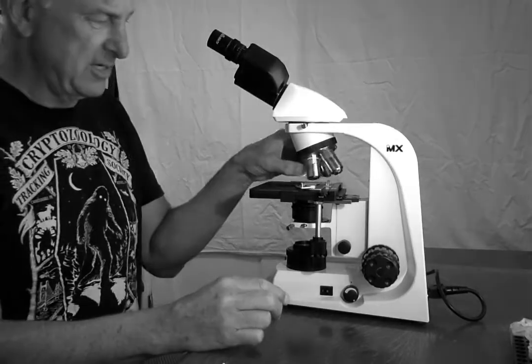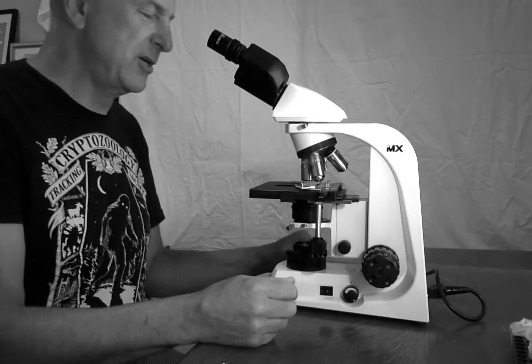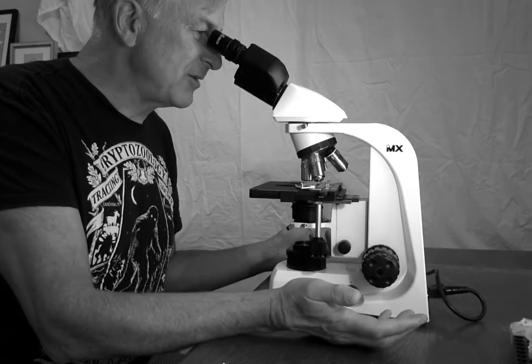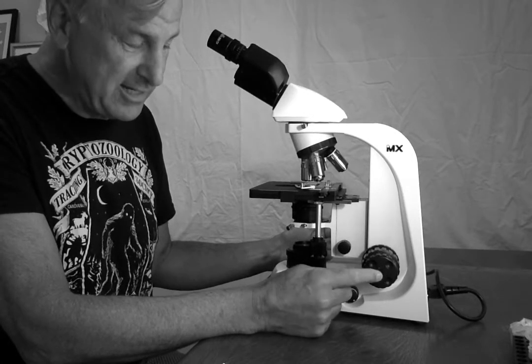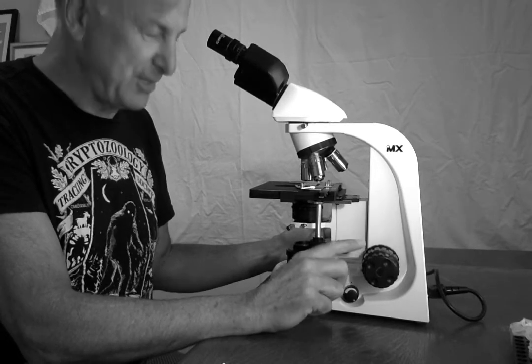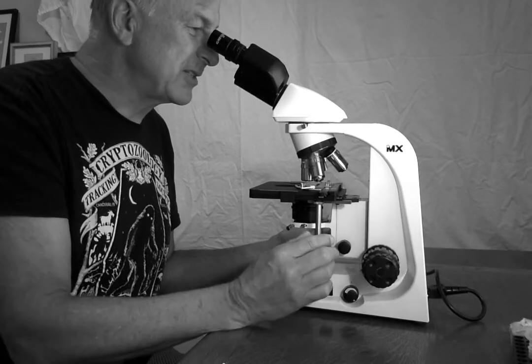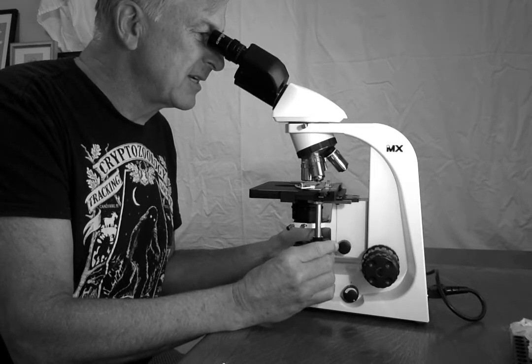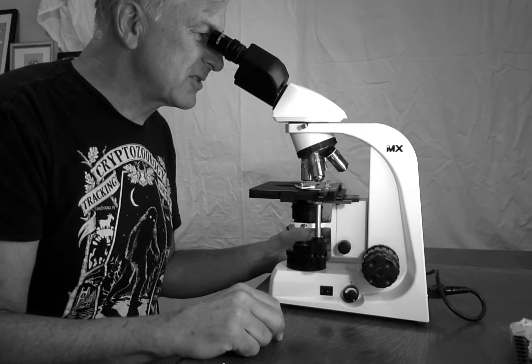So let's move to the next objective, which is the 10x objective. And 10 times 10, I'm now looking at 100 power. And there it is still. It's almost in focus, and I only need to play now with the fine focus knob. The coarse focus knob is off limits. But fortunately, it's almost in focus, so I don't need to do much. I am going to raise this little item up a tiny bit. I want it centered because it's super cool, and let's imagine I'm drawing it, describing it.